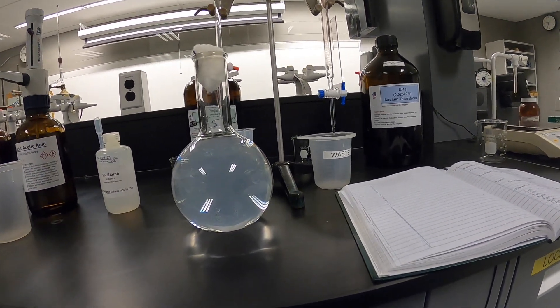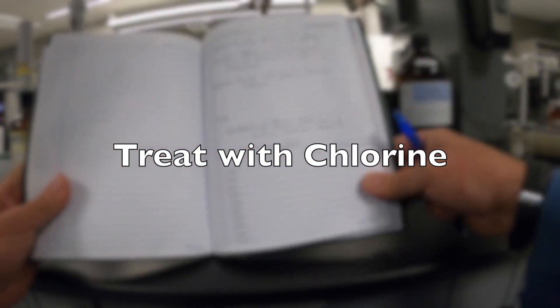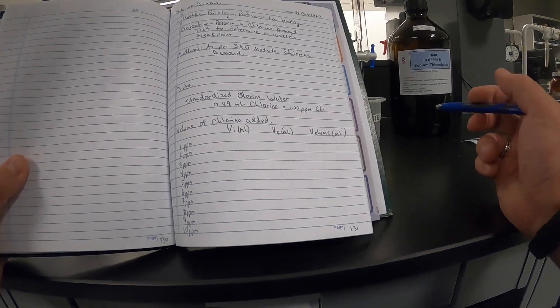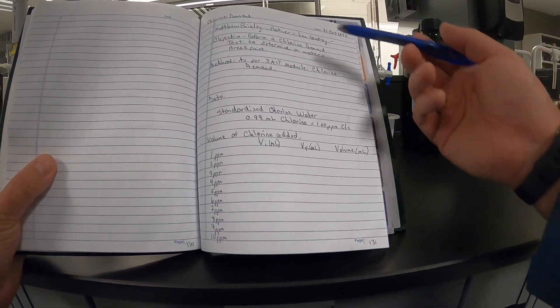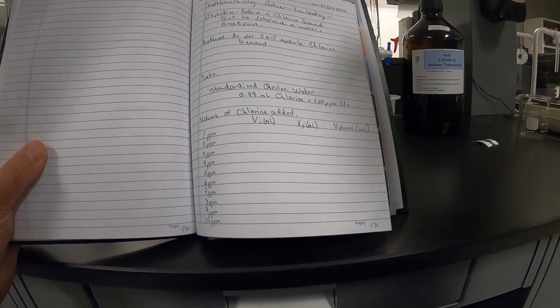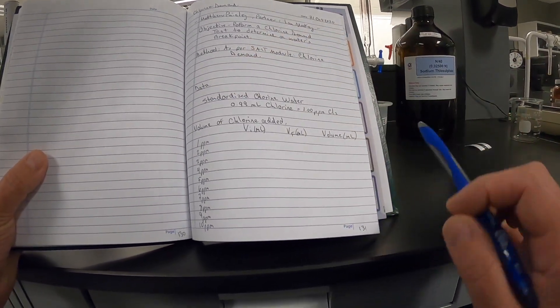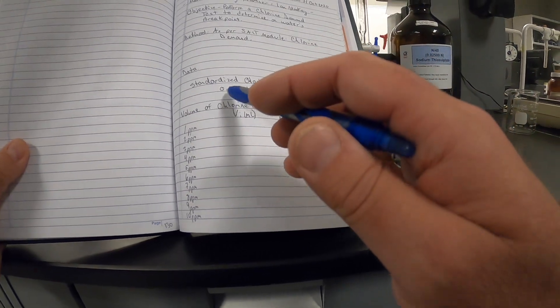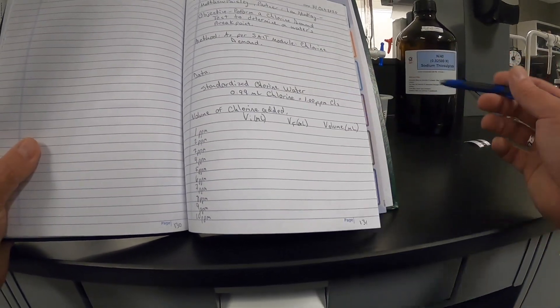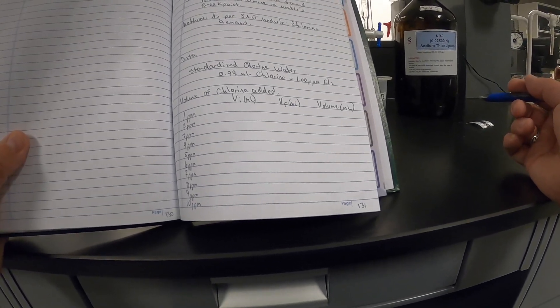In my lab book I've captured the title, the date, the people, the objective, and the methods. Under data I've also captured what was on the label: that 0.99 mL of chlorine is equal to one ppm in solution.